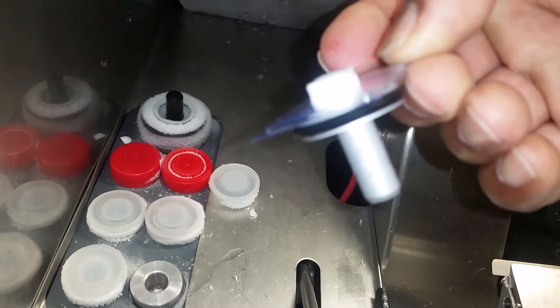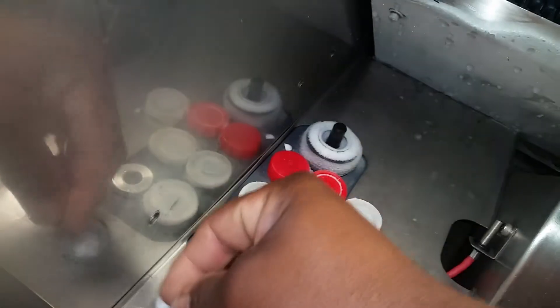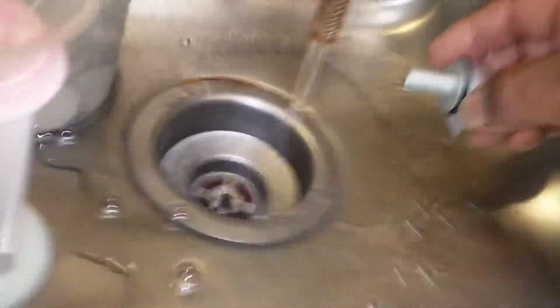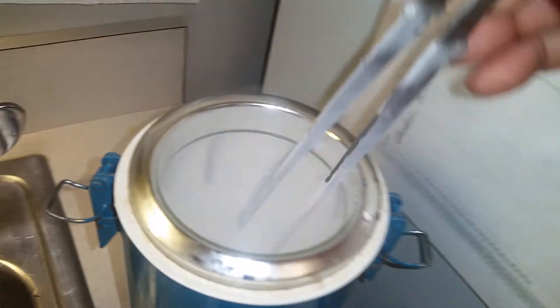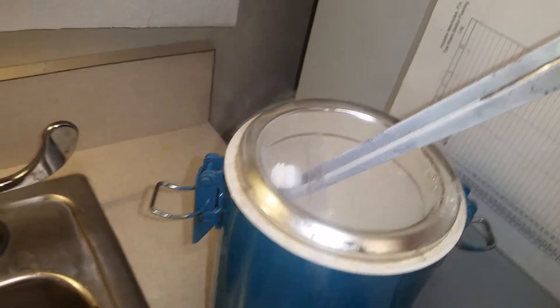Now I'll show you how I disconnect it. I'll get over here to my sink — I've got lukewarm water running. The block just falls right off. Then I'll drop it in liquid nitrogen and get it ready to be placed back in the deep freezer.